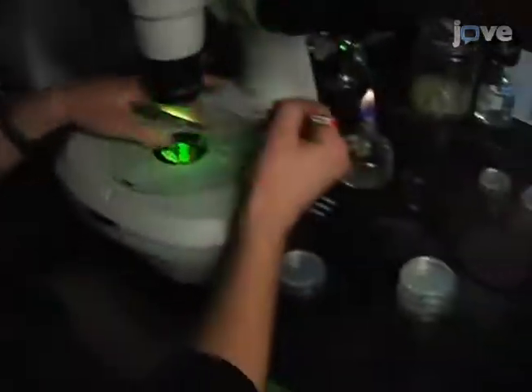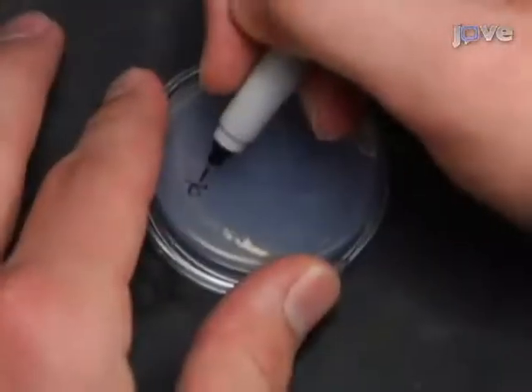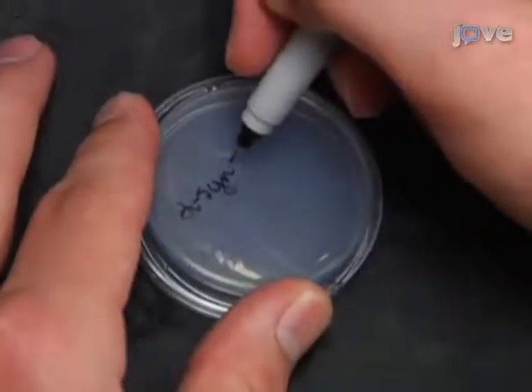Hi, I'm Adam Knight, an undergraduate student from the Caldwell Laboratory in the Department of Biological Sciences at the University of Alabama. Today, myself and others will show how to perform a dopamine neuron degeneration assay in C. elegans. I will be crossing a dopamine neurodegenerative worm strain with transgenic strains that overexpress candidate disease-related genes in dopamine neurons.